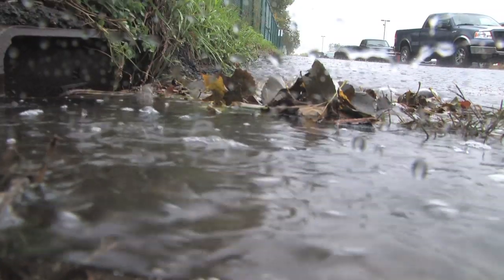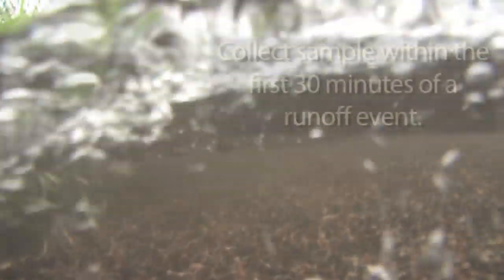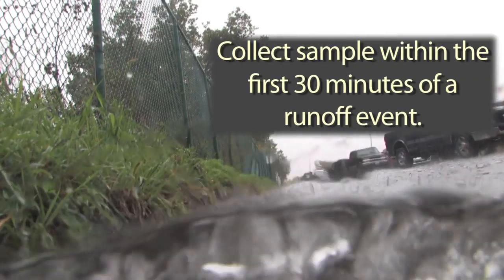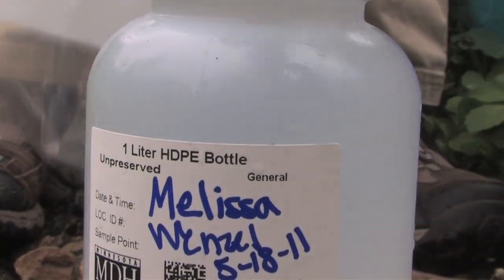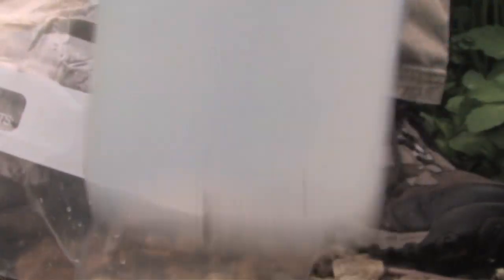Be sure to choose a time and location where stormwater is flowing, and collect the sample within the first 30 minutes of a measurable runoff event. Before you go outside, write the name of the person collecting the sample and the date.